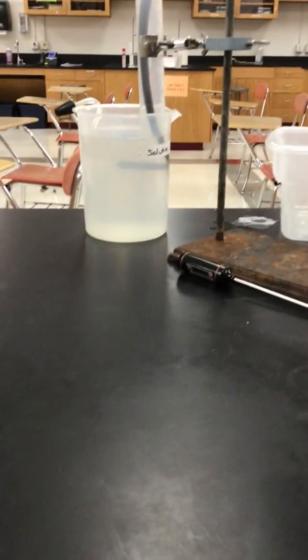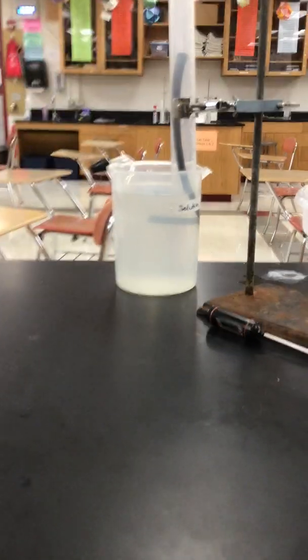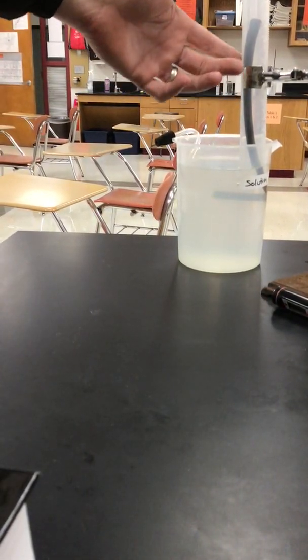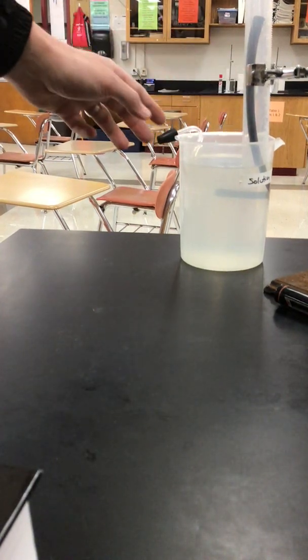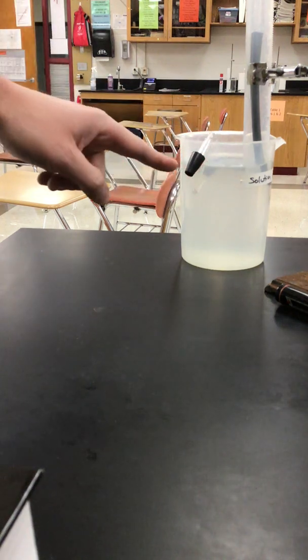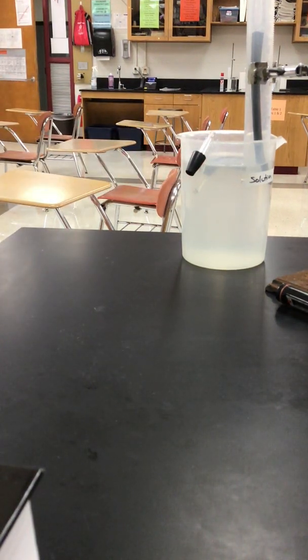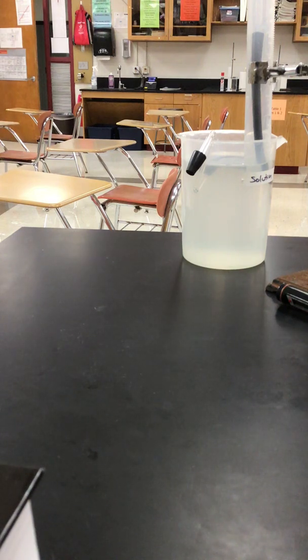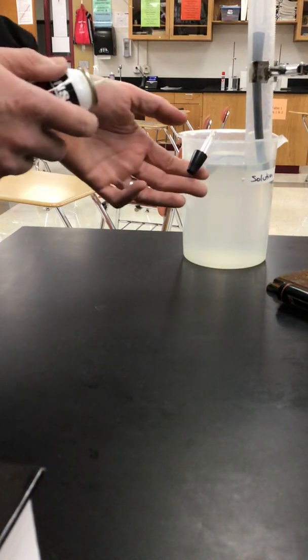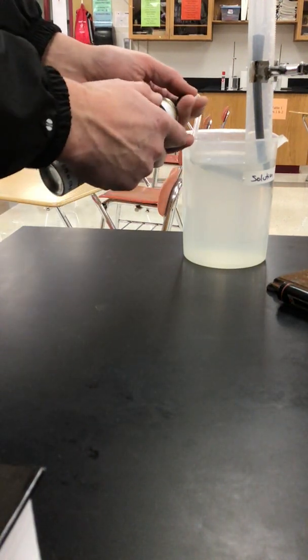Then, as you can see here, I have the setup of the apparatus. In this, I've got a graduated cylinder that is filled with water all the way to the top, and I have placed a tube in it, which is connected to this little mechanism called a gas collection tube. Okay, I'm going to attach the butane cylinder to it and simply discharge some of the gas into that cylinder, and fill it to a certain amount.